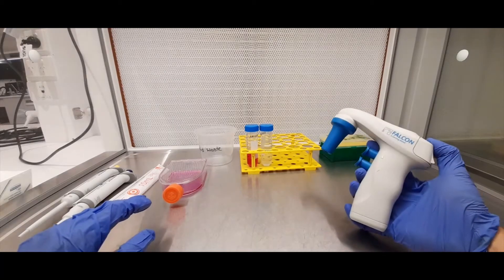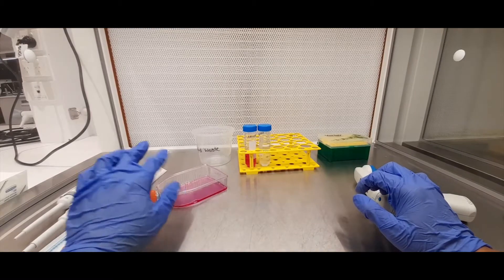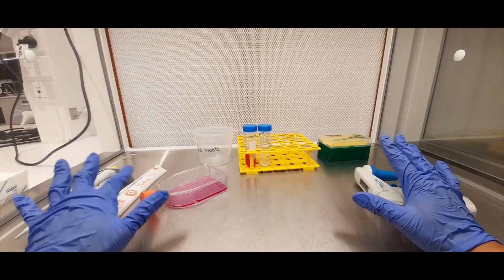So now that you know how to use one of these pipette aids or pipette guns, I'll show you how to properly work with a flask of cells inside a biosafety cabinet such as this.